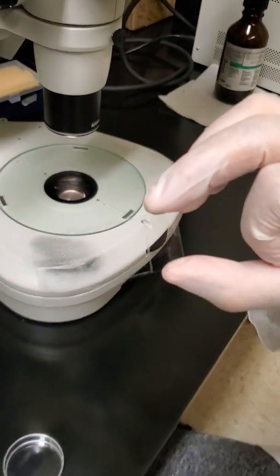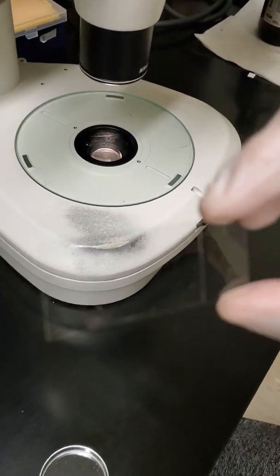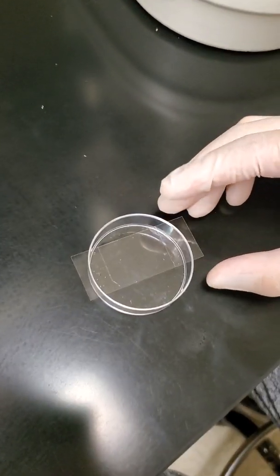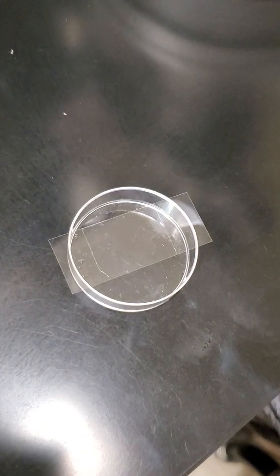So you can see the slide has a little bit of agarose. If you put it on the table, I can focus better. There's a little bit of agarose in the middle of the slide. That's that square there.